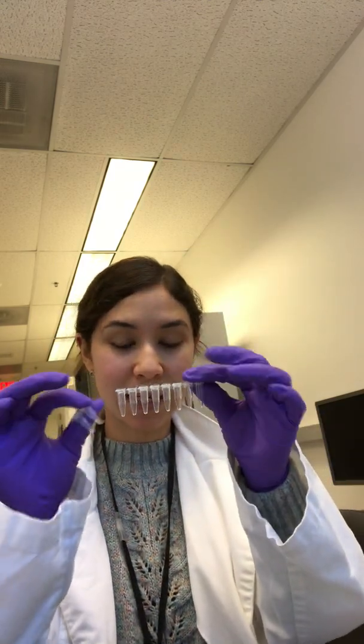After your nested product is put in, your samples are put in, you're putting this into the thermocycler, and you're running that for another 2 hours. Again, it doesn't have to be all done in the same day. It can be broken up. Just make sure you put your iPCR in the fridge in the dirty room once it's completed. So after that's done, yay, we're done with the PCR step. After that, you're pulling that out of the thermocycler, putting it in the fridge, clearly label it, and you're going to be running a gel on that to see if there's product.